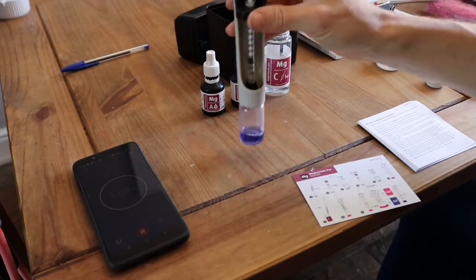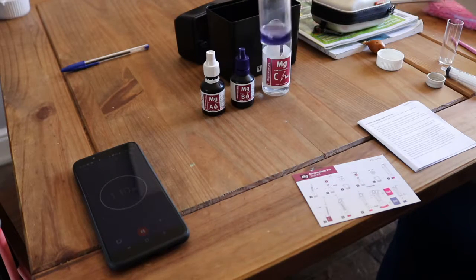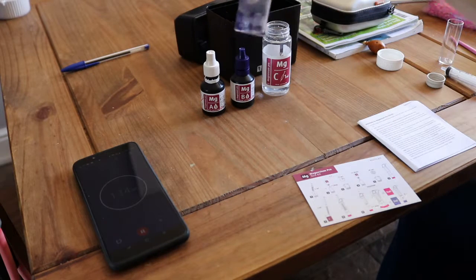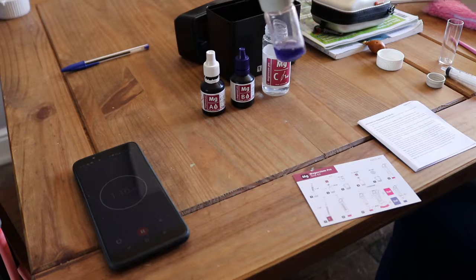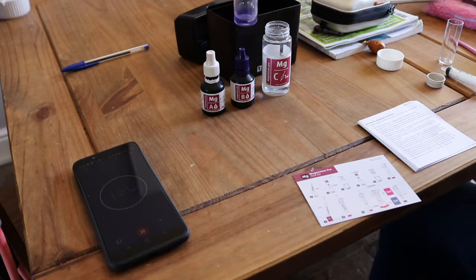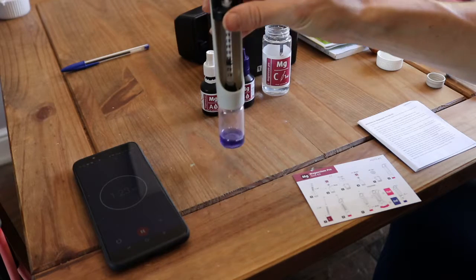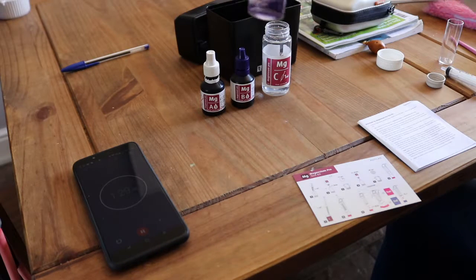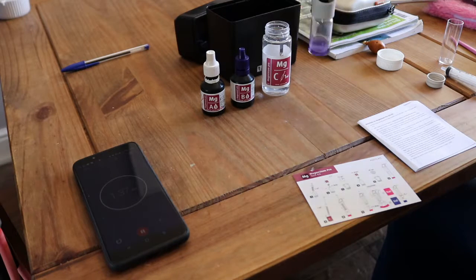So there we go, but you will see, the camera might not pick it up, you can see already, it's already moving away from that blue. And another 10 seconds or so, it will go purpley. Oh, there you go, you can see it's very similar to the lid of B, which is a purpley colour. So you take that, you stop when you first see the whole thing change blue. You don't keep going, because that now has definitely gone purple. Now if you keep going, that's going to go blue again. And again, I was making that mistake, and that'll give you a ridiculously high magnesium reading.